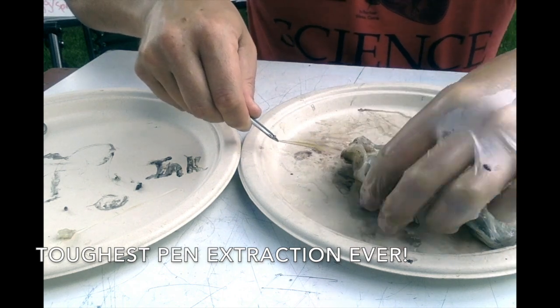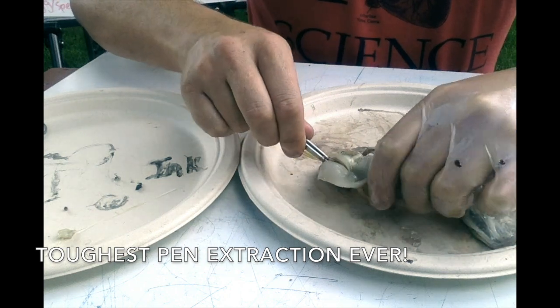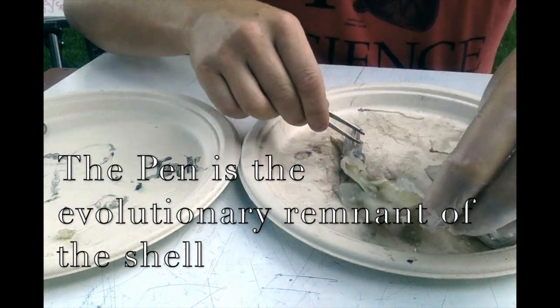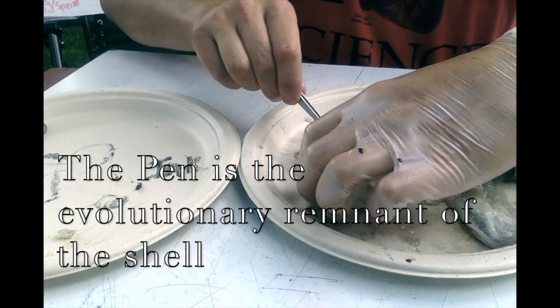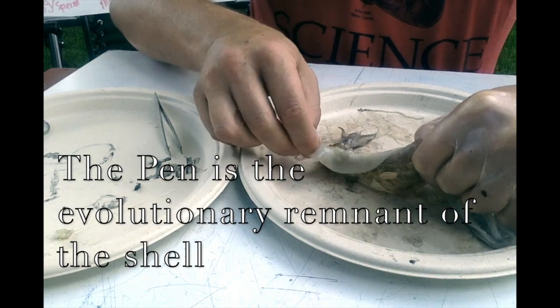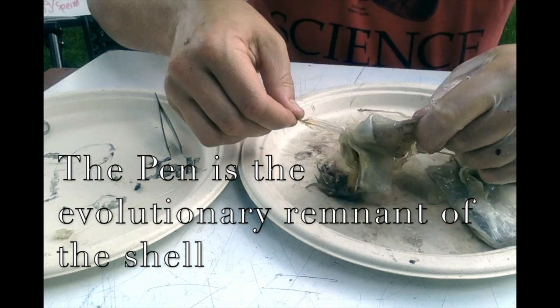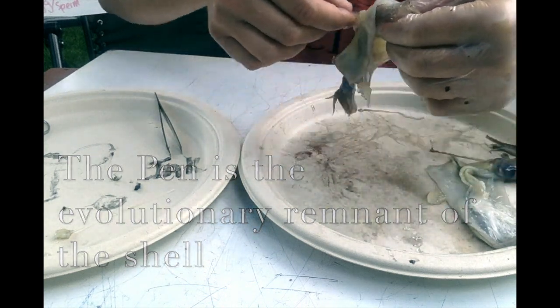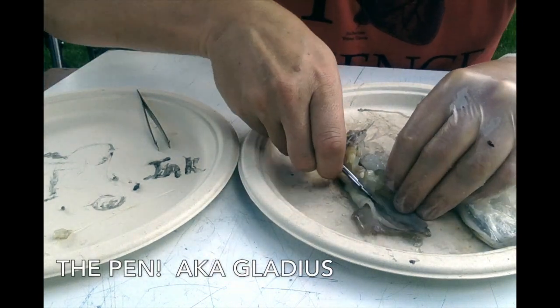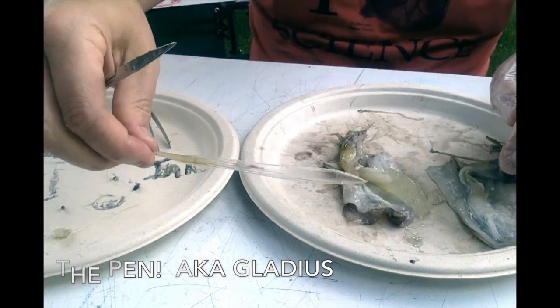Pull it out pretty carefully so it doesn't get destroyed. This one's a tough one. Sometimes you just gotta do it with your hands. Oh, this one's surprisingly difficult. It's really well attached at the top, and that might be because these squid have been frozen a couple times and thawed out a couple times. All right, here is our pen.